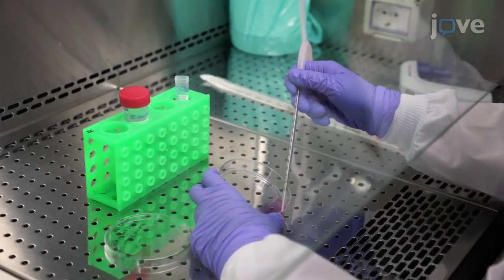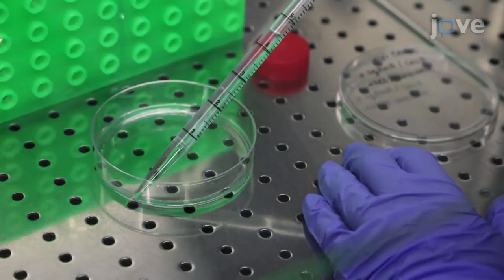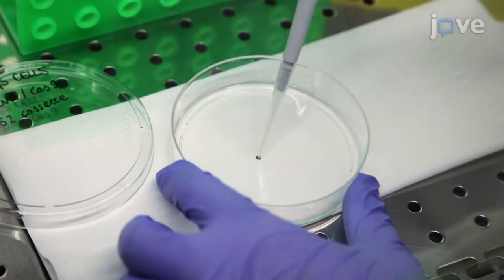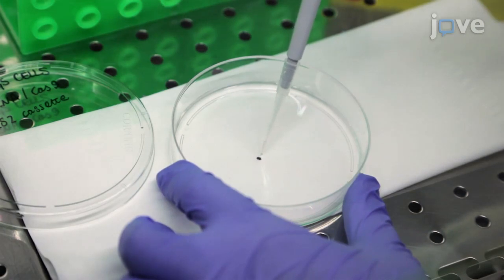Using a microscope and a marker, mark the position of each clone visible in the dish. Replace the neomycin culturing medium with enough PBS to form a thin film of liquid on the clones. Using a 10 microliter pipette containing 5 microliters of trypsin, slowly release the trypsin onto the colony. Allow the trypsin to detach the cells for 1 minute.